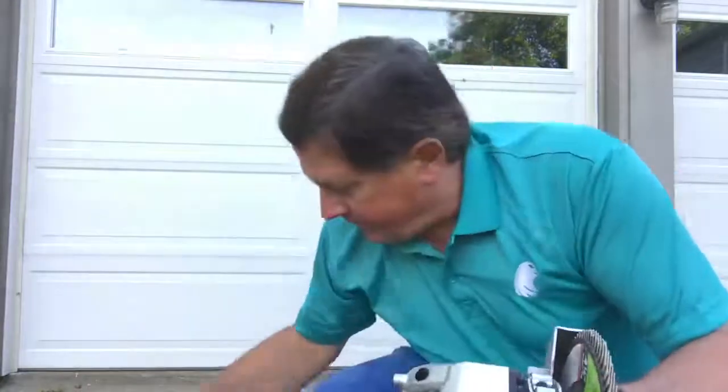Important to have a flapper wheel because you don't want to overheat the surface of the metal that you're cleaning off. And a flapper wheel tends to self-cool. So now, safety first, I'm going to grind that surface.